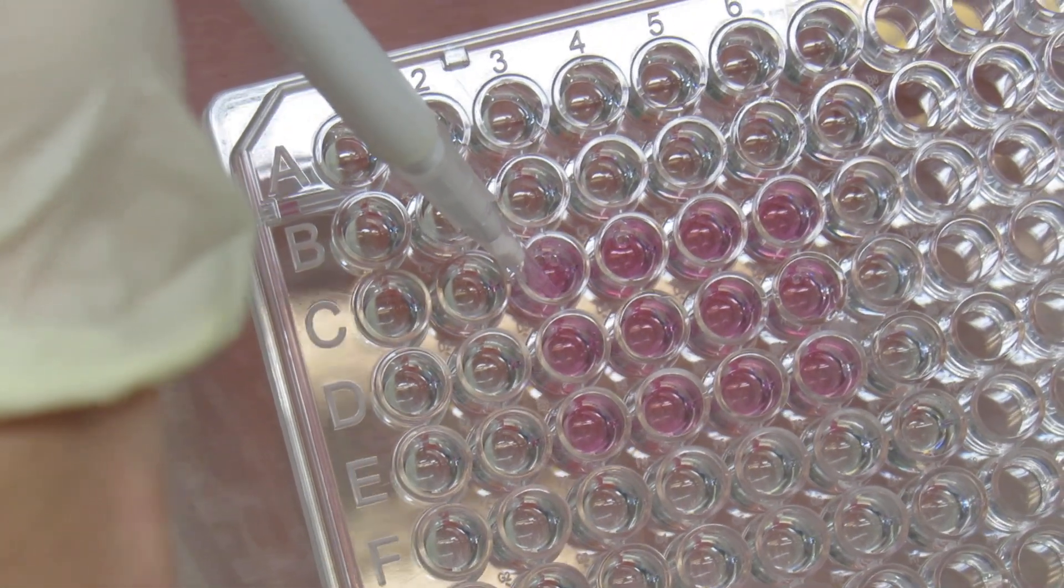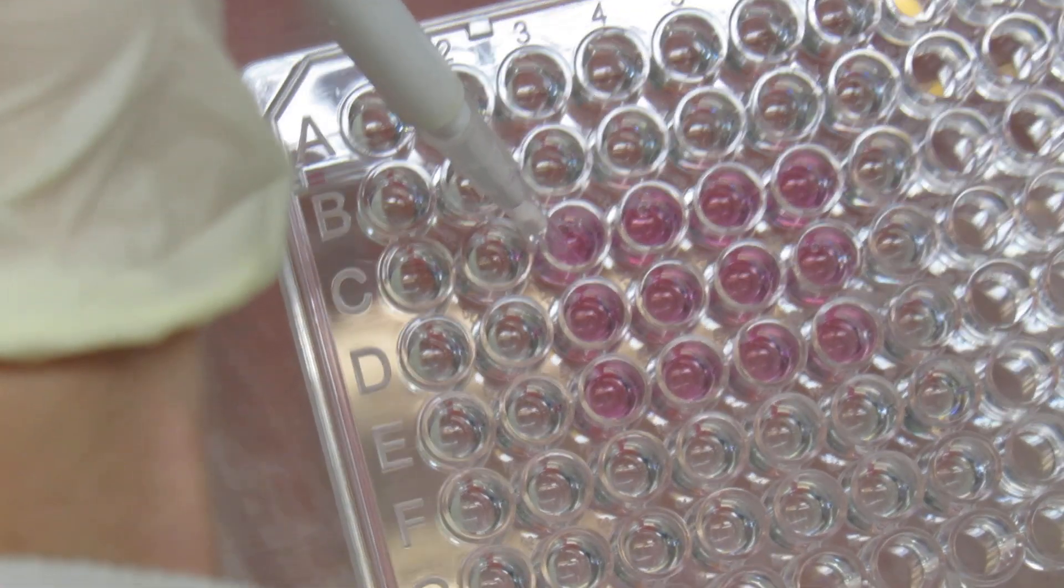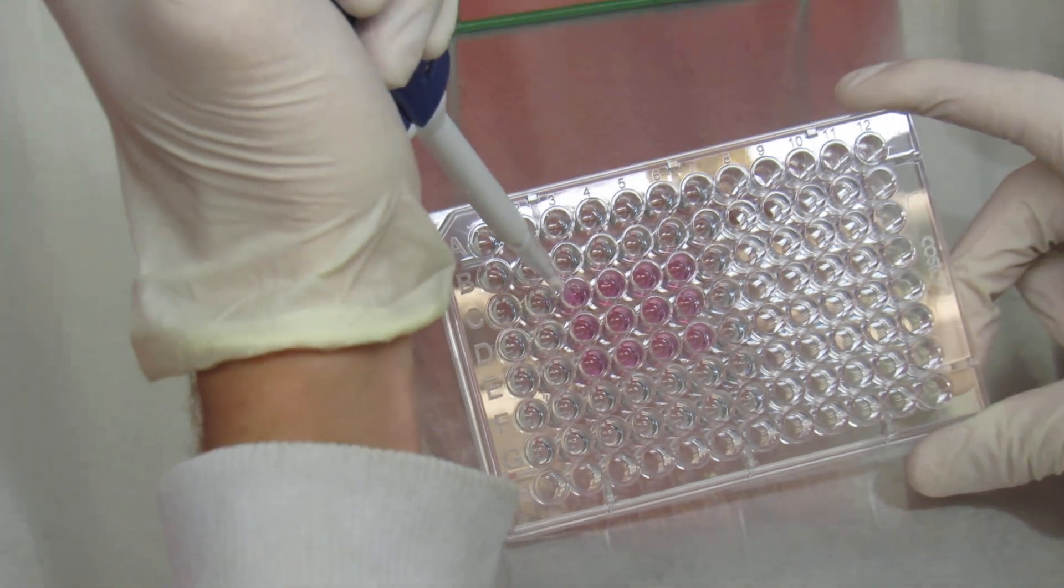I'm going to pipette it up and down five times. It doesn't have to be exact. If you forget to count, that is okay.